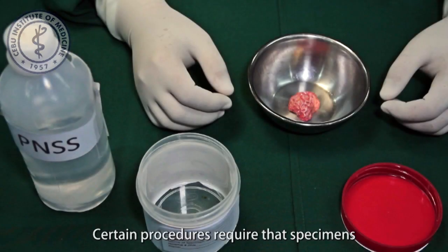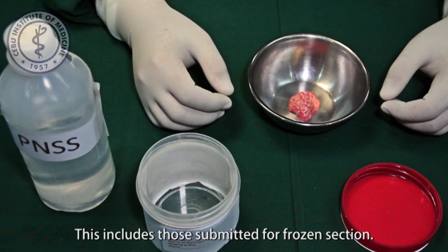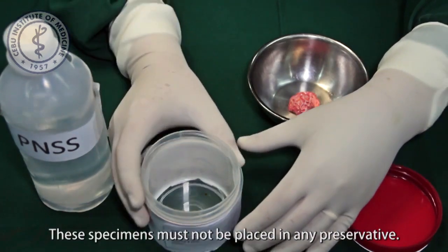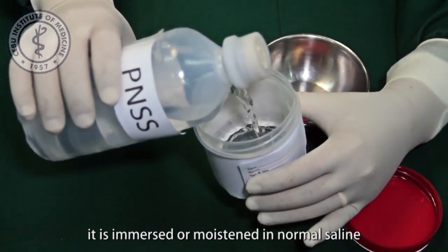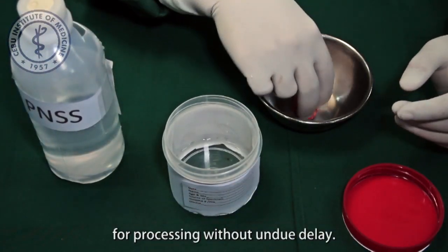Certain procedures require that specimens should be processed fresh. This includes those submitted for frozen section. These specimens must not be placed in any preservative. Once the specimen for frozen section is removed from the body, it is immersed or moistened in normal saline and immediately brought to the laboratory for processing without undue delay.